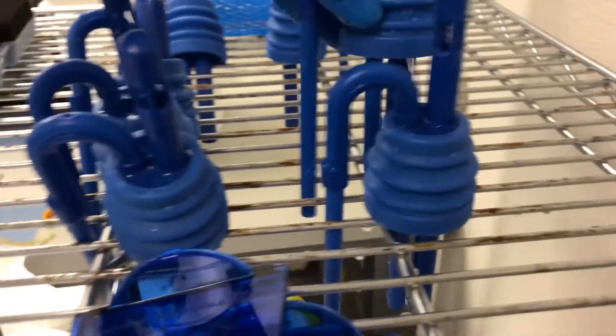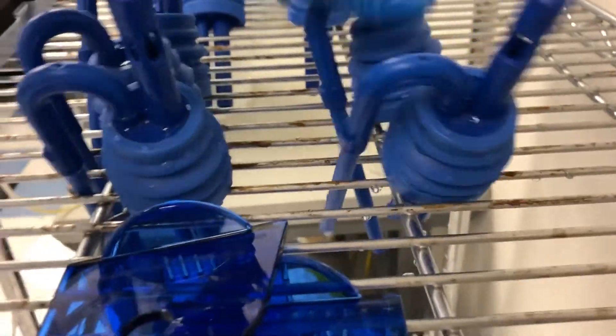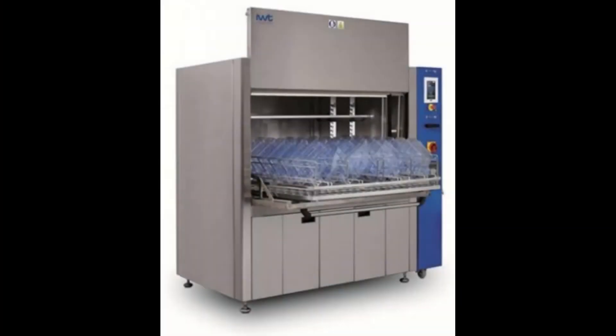So as you can see this is a fairly time-consuming and laborious process. We hope to be getting one of these large cage washing systems soon enough.